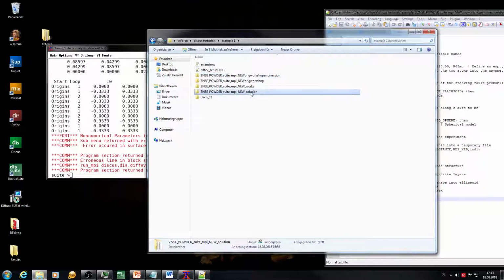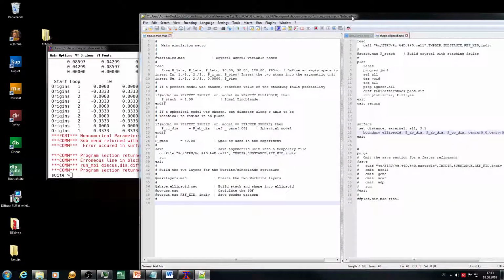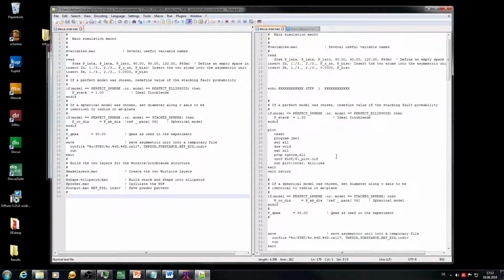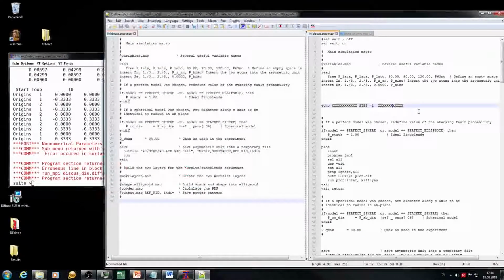For comparison, we look now at my macro, which I have written, which is pretty much the same macro. You can compare it easily if I'm shifting it over there. Here it is. So this is the original one, this is the modified version. I've put in a set wait on, that's normally used in Discus anyway. And after that I try to do some segmentations in the macro. So I have here the echo command. The echo command is writing out this line to the prompt, so pretty much to this window, and there we can see where the macro is actually working at the moment, and we can see where it actually stops, or which step it reaches and which not.